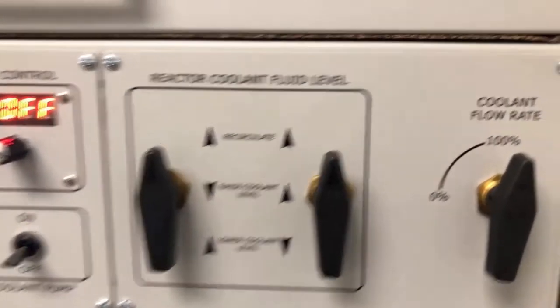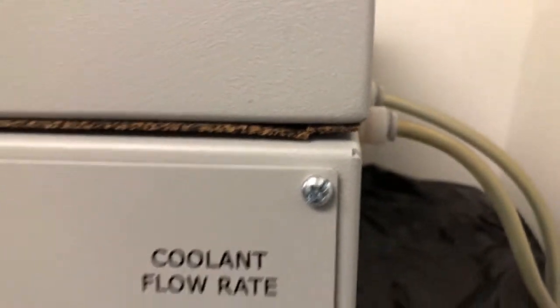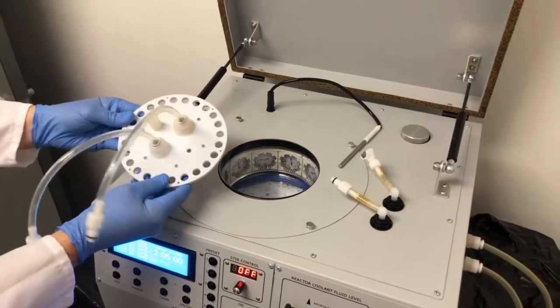Peeking all the way along the right side of the machine, you can see the connection ports to the heater chiller. Now that we've quickly covered the instrument panel, let's demonstrate setting up a reaction.